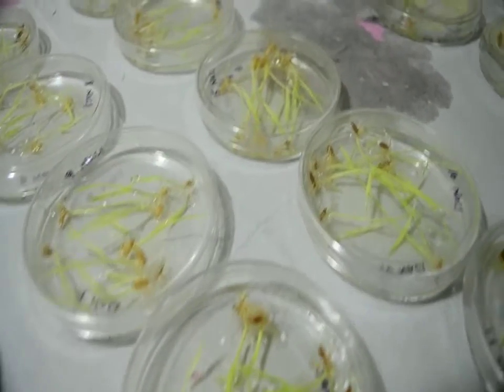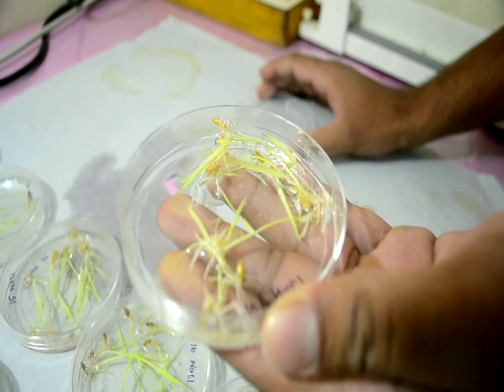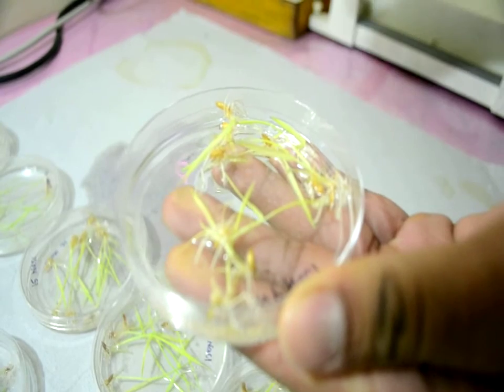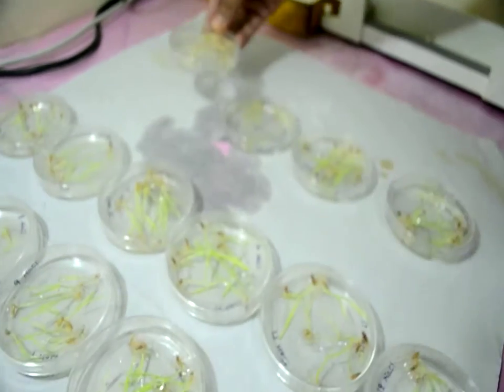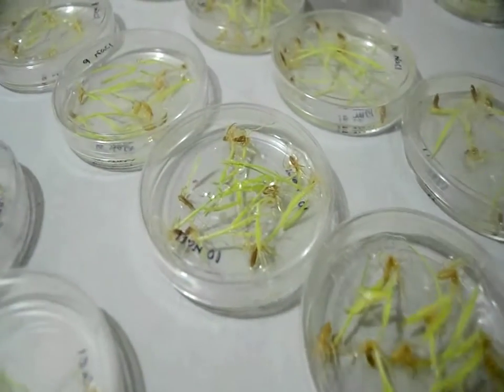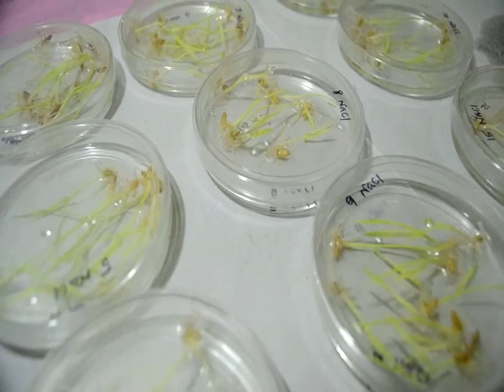This is one of the plates, which contains around eight to ten seeds. The seeds grow only with the nutrient reserve in the seeds and water for support during germination. By this method, shoot length and root length are measured after a week's time, making it very helpful to screen salinity tolerance at the seedling stage in rice.